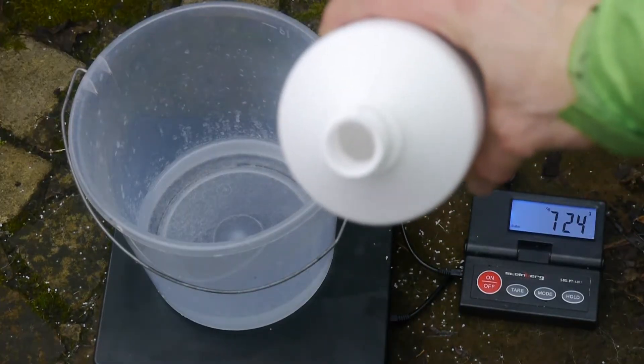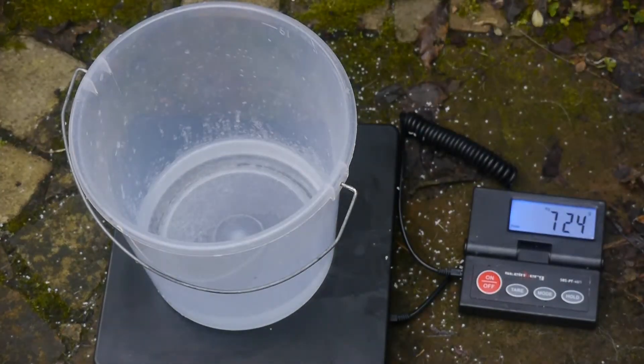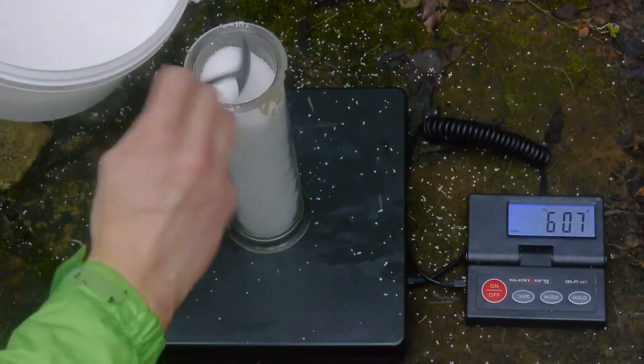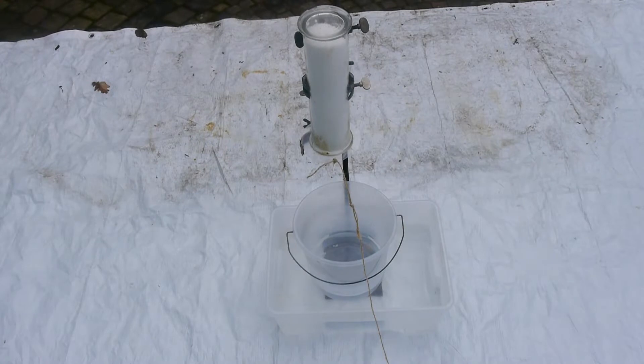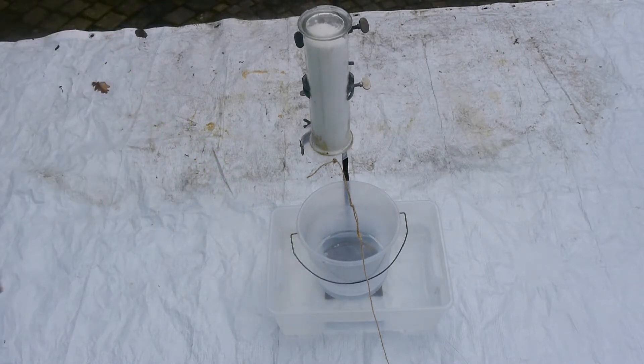The acetic acid partially froze in the bottle — it's always fun, and now it's freezing in the bucket. To that we will be adding 666 grams of sodium hydroxide, which is one equivalent. Doing stuff like this is obviously relatively dangerous, so I am using special apparatus. The acetic acid is down here in a plastic bottle so we don't have any glass.